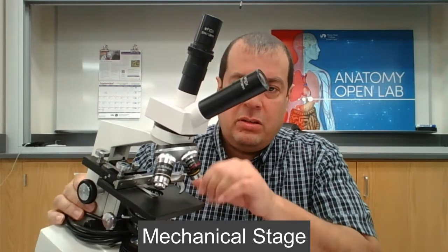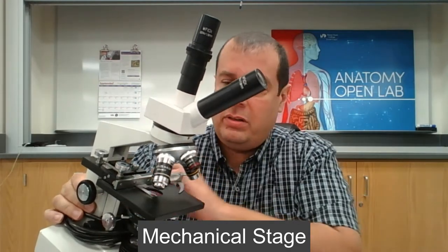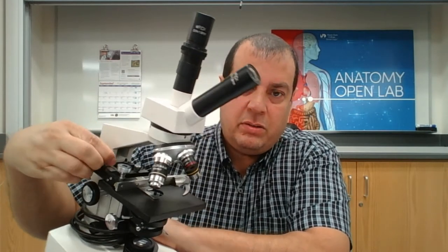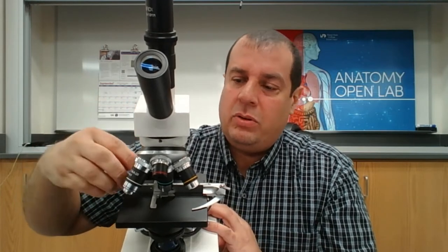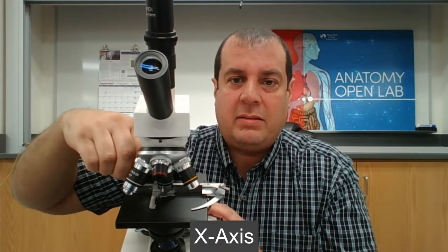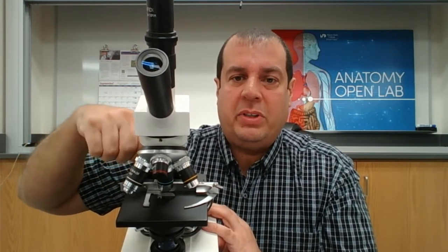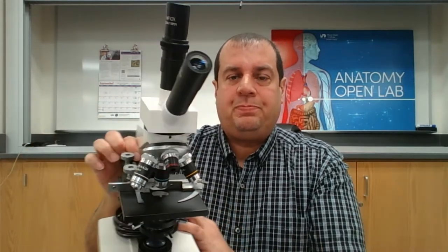Next we have the mechanical stage. This part right here is the mechanical stage. The silver knob here allows you to move the mechanical stage along the y-axis, and then this one will let you move left to right along the x-axis. That allows you to put the microscope slide in and move it around. This is the stage itself — that's where you place the microscope slide.